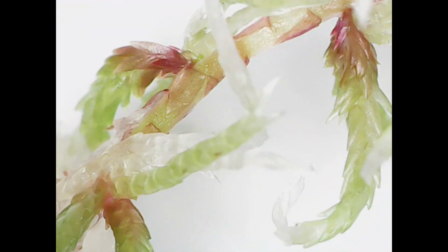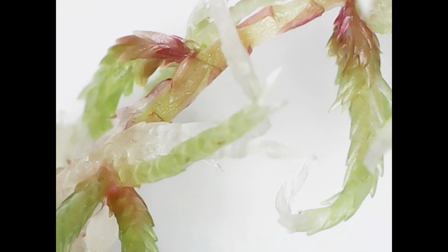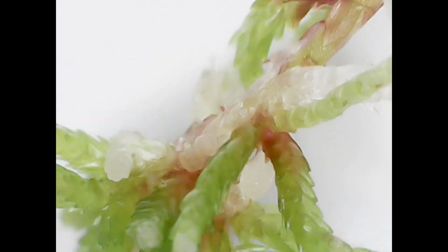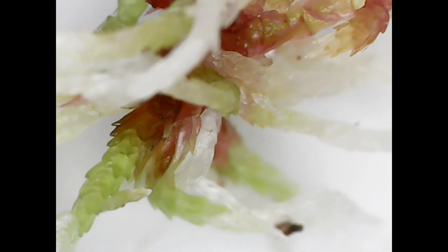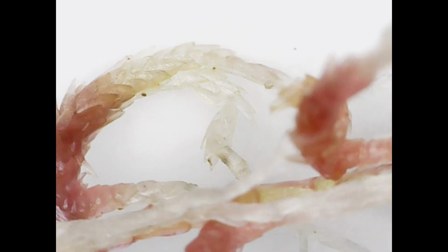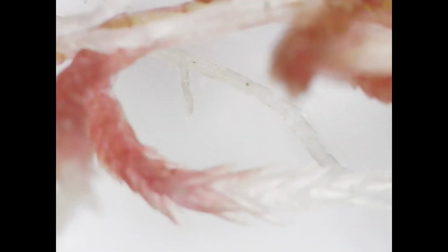One of the first things that we're going to be looking at under the microscope is sphagnum moss. What you can see here with the sphagnum moss is some of the coloration on the actual moss itself, some of those red areas, some of the green areas, because you need to remember this is still a living material. And this is sphagnum moss from Soil Ninja, which is really cool. You might be able to see some of the more white tips, and in this section of the video you're getting the leaf structures almost. That's what I would imagine they are. They look a bit like scales, but I would imagine those would be the leaf structures of the sphagnum moss itself.